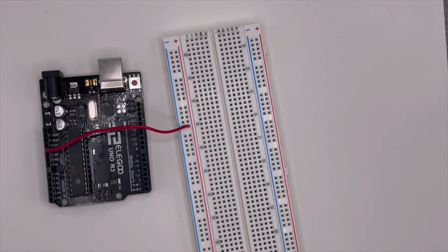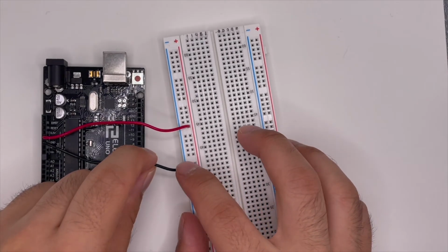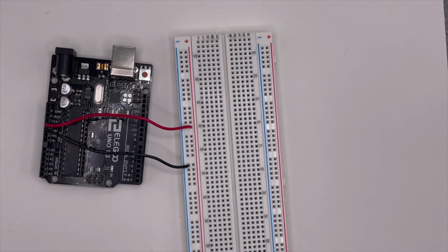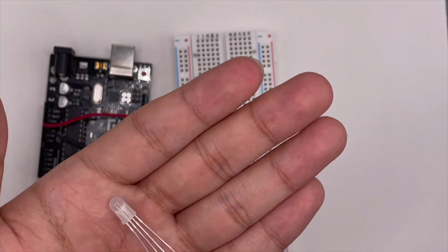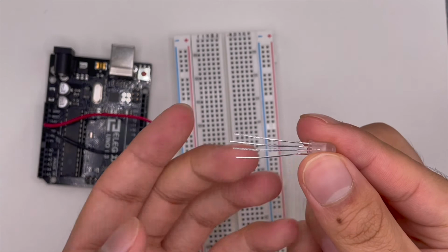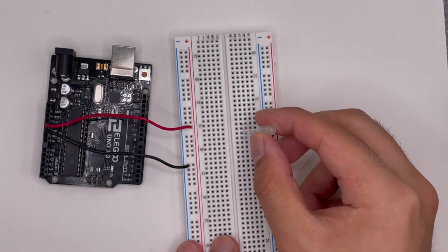We also need to ground the circuit, so connect a wire from the ground pin of the Arduino to the negative bus line of the breadboard. After we do that, we can start connecting the LED. If you notice on the LED, one of the pins is longer than the others, and this is the ground pin. You need to keep that in mind as you place it on the board. Place the ground pin so the longer end is facing outwards like this. Once you place it inside the breadboard, you can go really anywhere, as long as it's on this half of the breadboard.